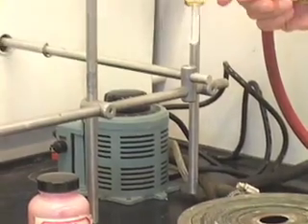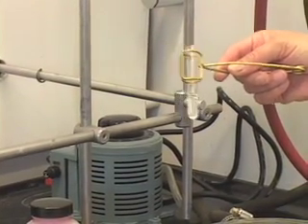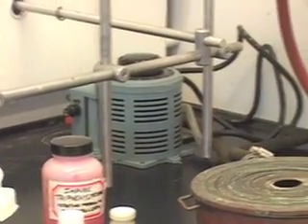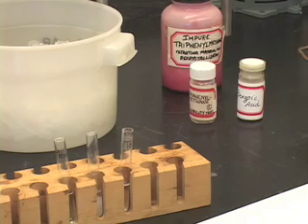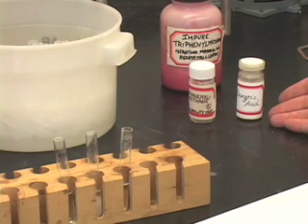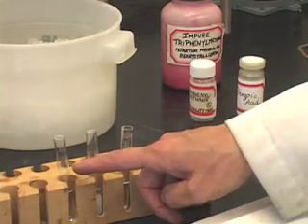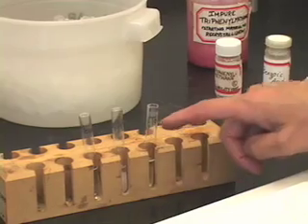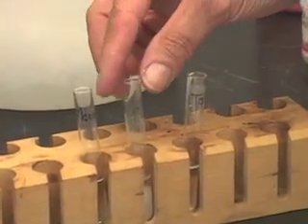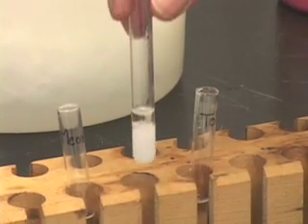Since there is already solid in the test tube, there is no point in cooling this test tube in the ice bath, because what will happen? You will notice the same solid back again. So, we figured out the suitable solvent for recrystallizing benzoic acid. We tested its solubility in methanol, water and toluene, and found out that water was the most suitable solvent for recrystallizing benzoic acid.